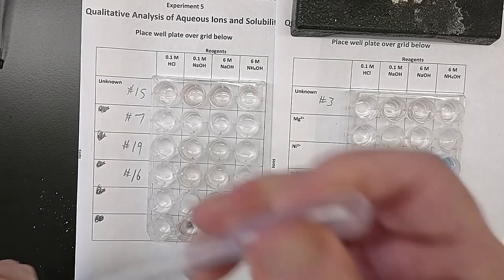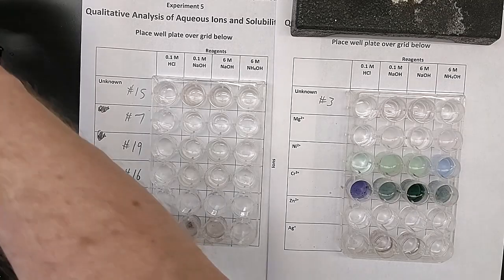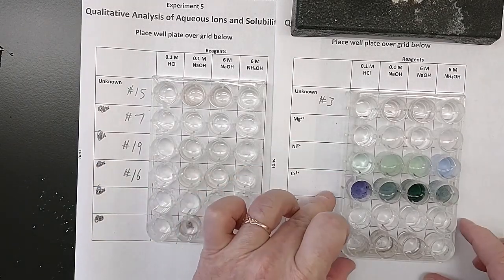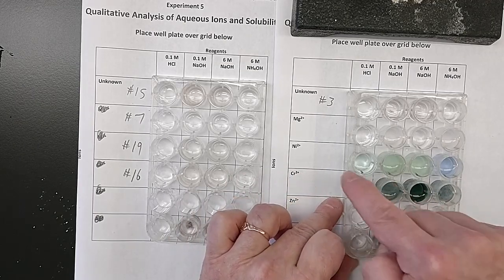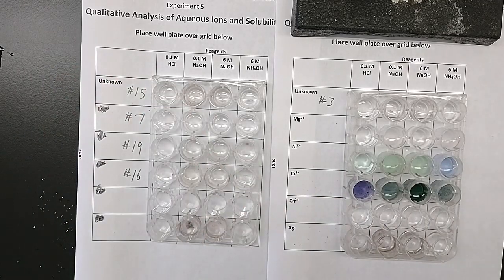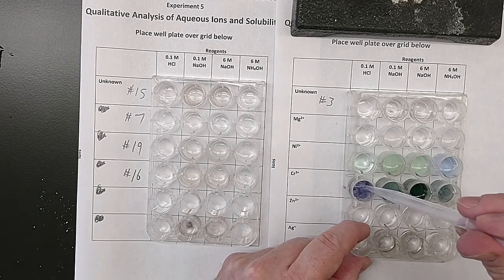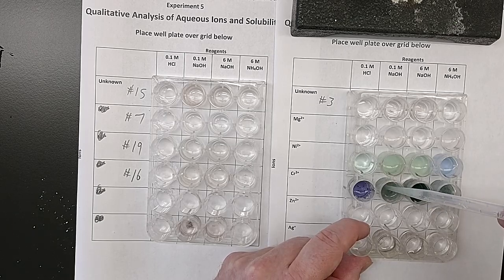Key point here is that we've definitely got completely different physical behavior due to the chemical behavior, right? There's a chemical reaction going on here between these things, and we have different colors. Chromium looks very different than nickel, looks very different than magnesium. That's great for us. We can figure out what we've got. Stirring them again. These are some old solutions, haven't been used in a while, so there's some chunks of stuff in there that we're just going to ignore.